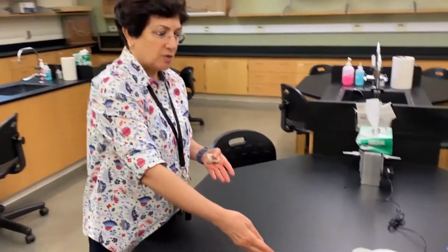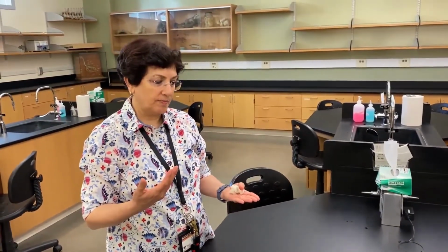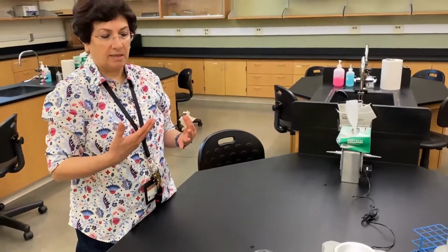Now the dialysis part of this experiment. In the dialysis tube we have starch and we have glucose. Which molecule do you think is going to be leaving the dialysis tube and going into the water in the beaker? Again, when we discussed the dialysis tube, we said it had microscopic pores, and those microscopic pores are going to allow smaller molecules to cross rather than larger molecules.